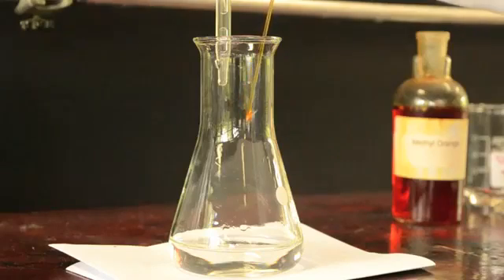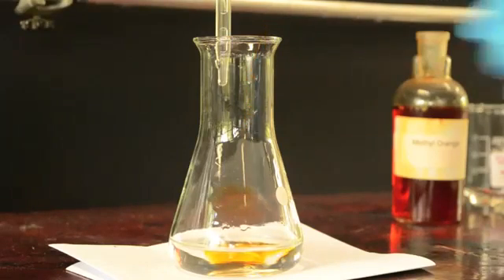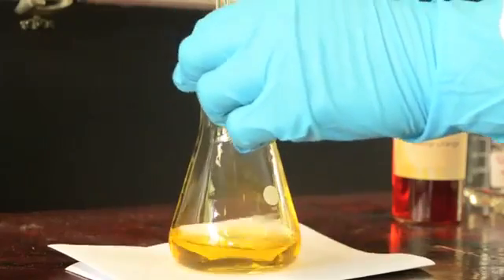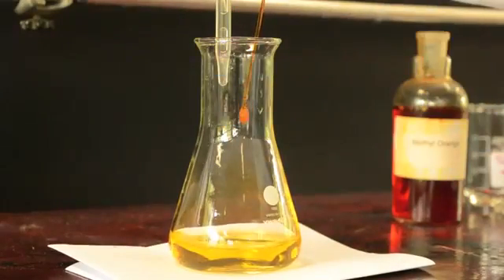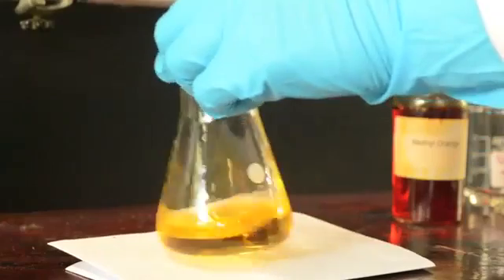At this point, we add a few drops of methyl orange to the basic solution in the conical flask. Just enough that I see a color in the solution.